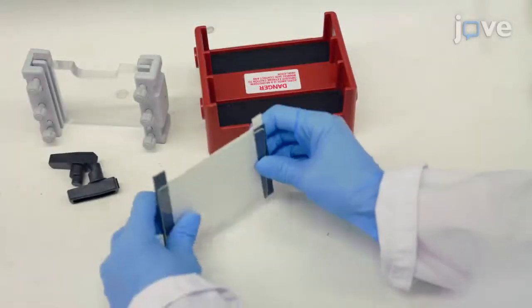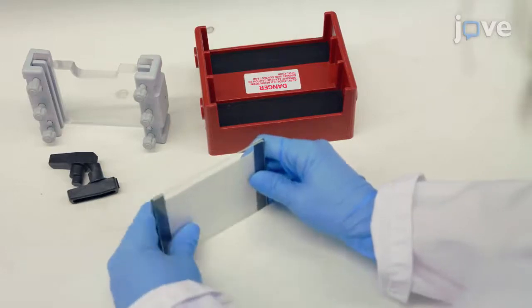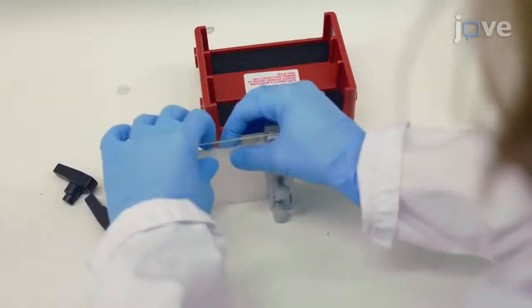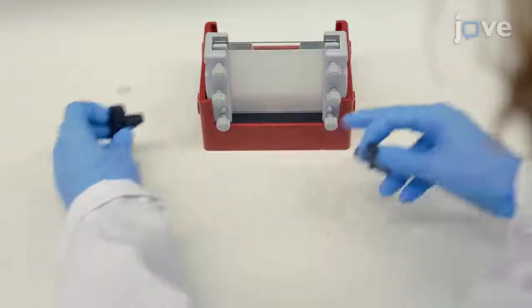Set up the gel caster with 8 cm by 10 cm plates according to manufacturer's instructions using 0.75 mm spacers.